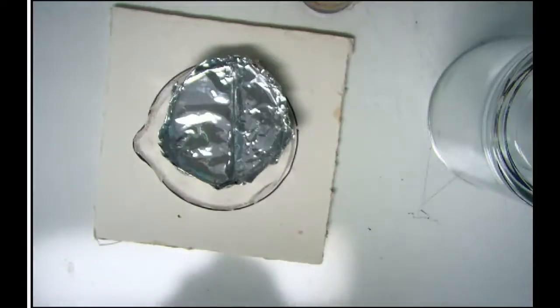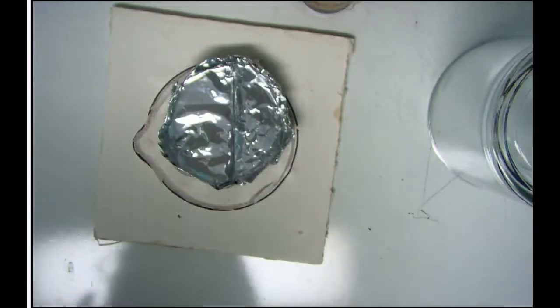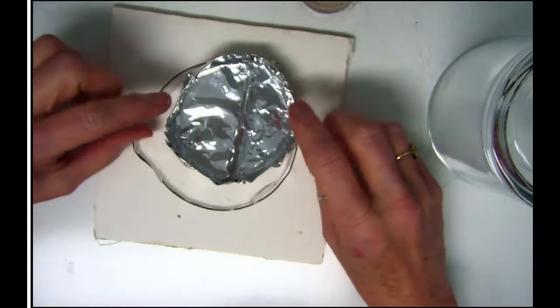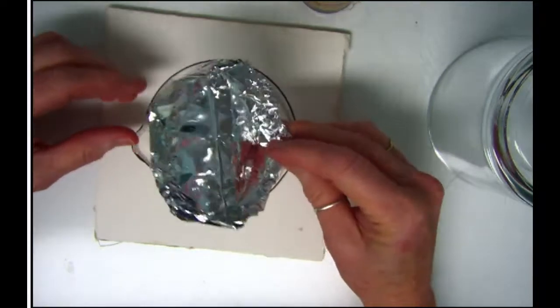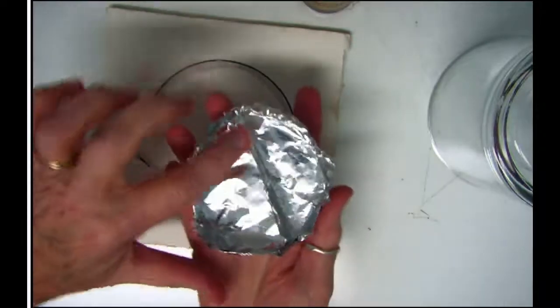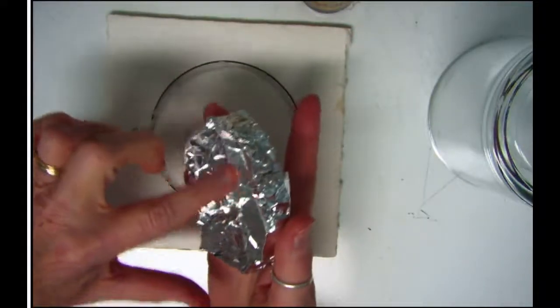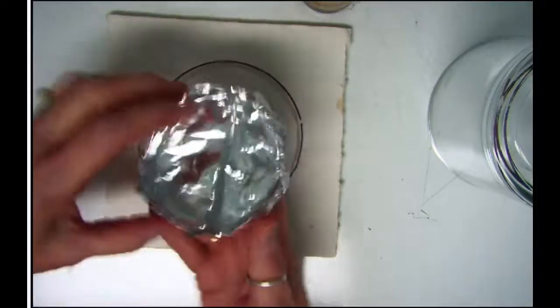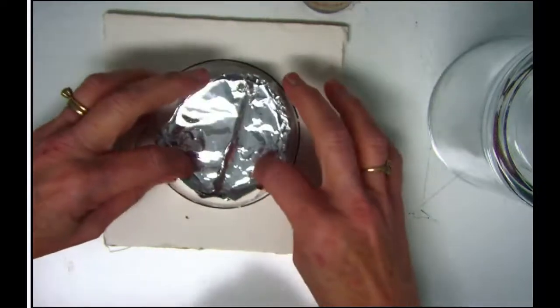Okay. So the next demonstration I just wanted you to see for the gases is that we know that gases expand. Well, they fill the container, but they automatically diffuse. So what you see below you is a piece of aluminum foil, and it's been made into a boat, and there's a centerpiece of aluminum foil right there in the middle that will keep my two liquids that I'm putting here. It's going to keep it separated.